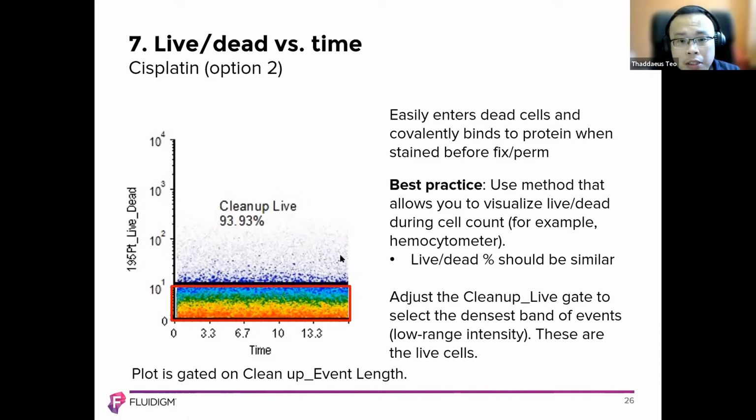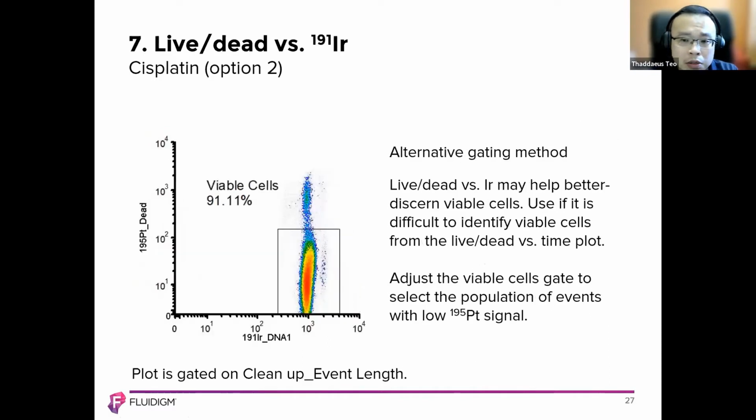Why? Because it turns out that macrophages and dendritic cells, due to their larger shape, right, of the mononuclear cells, they tend to pick up a little bit more cisplatin than anything else inside the rest of the cells. So you just need to be aware of this. You might want to be a little bit liberal in your gating if you're looking at macrophages in this section.